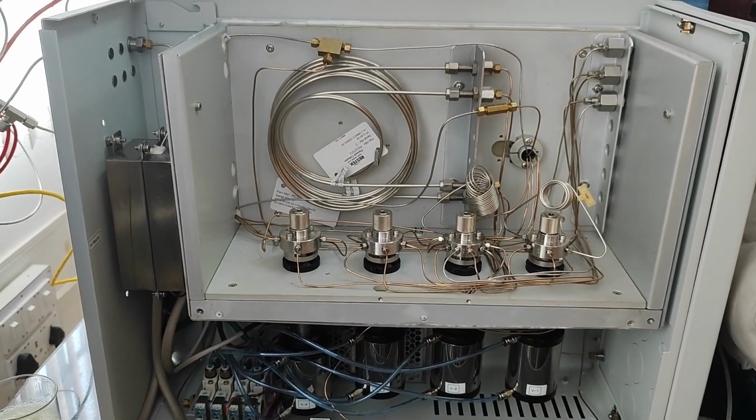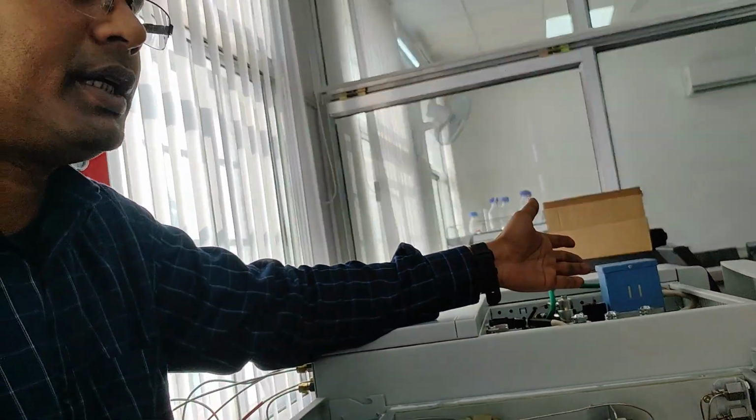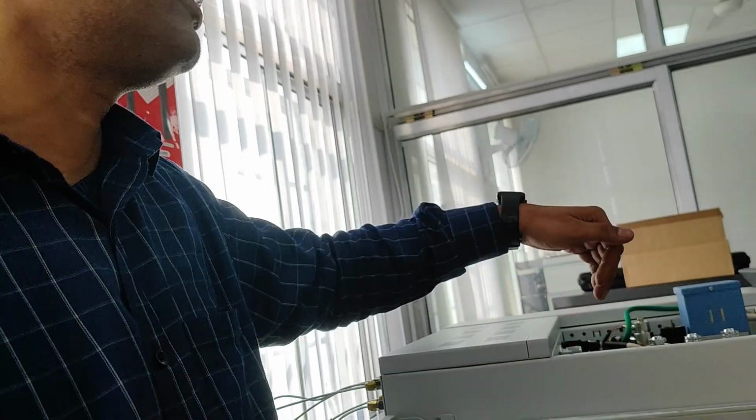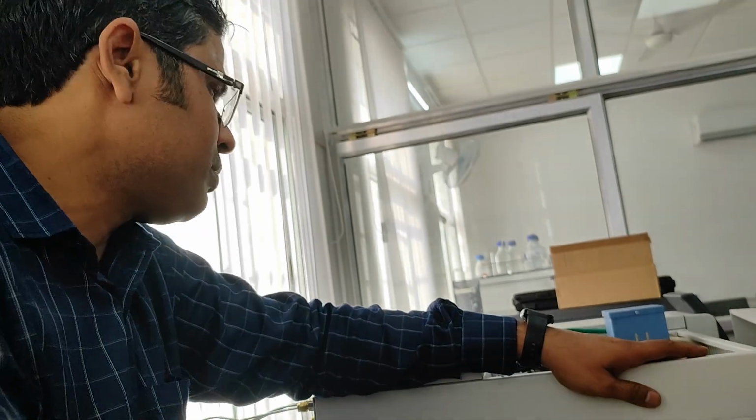If my sample contains a very high amount of CO and CH4, that will definitely give a peak in the TCD, so there is no need to use the methanizer, because the methanizer will be consumed. Very high amounts of CO2 and CO will convert into a very high amount of methane, so our methanizer consumption will be higher. At that time we can bypass. This is the bypass valve. And this valve is given separately for injecting into the ECD line. So one is for injecting the sample to the TCD line, one is the CSV column switching valve, one is to bypass the methanizer, and one is for the ECD line.